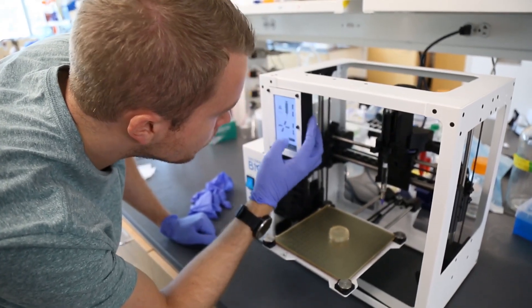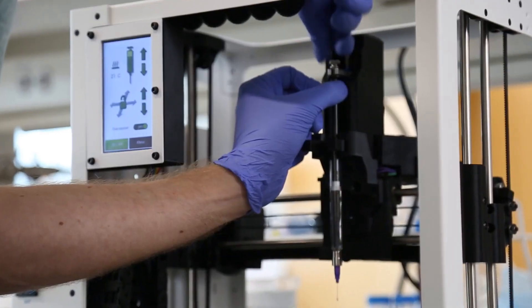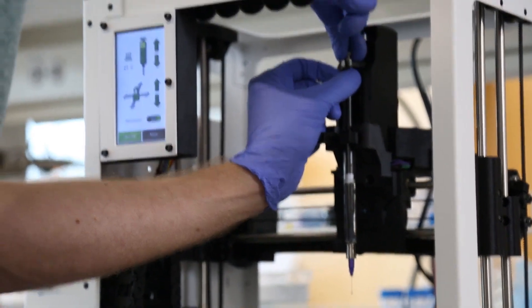Today we're gonna mix 100 milliliters of sodium alginate to print out of the LulzBot Bio and then we're gonna load that into the syringe pump.